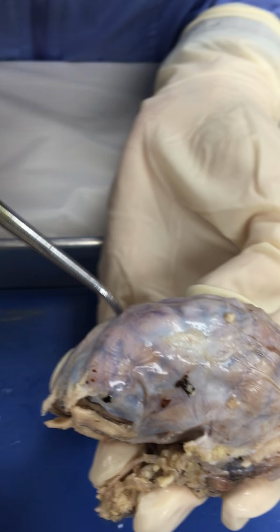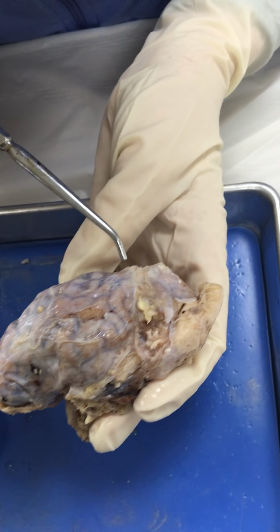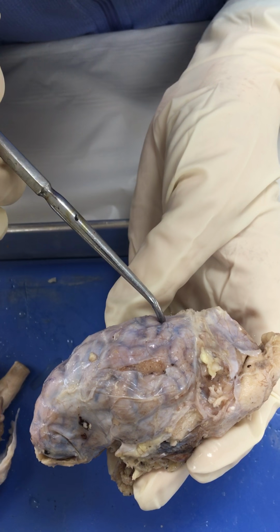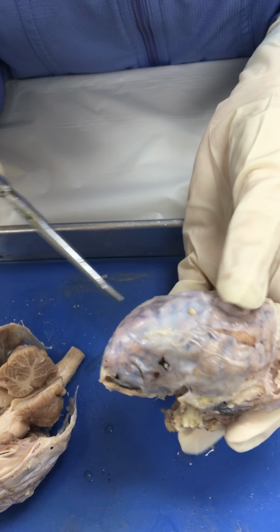This section is frontal lobe. We have parietal lobe about the center of the area, and then towards the back here is where eyesight is interpreted in the occipital lobe. Temporal lobe is going to be back up under there. I can't really see it from the outside.